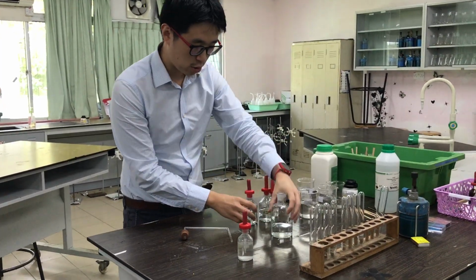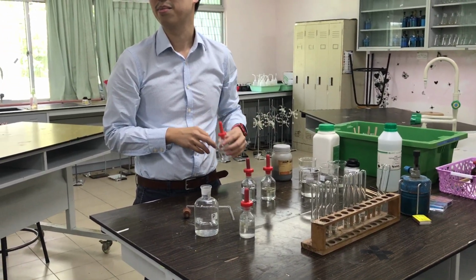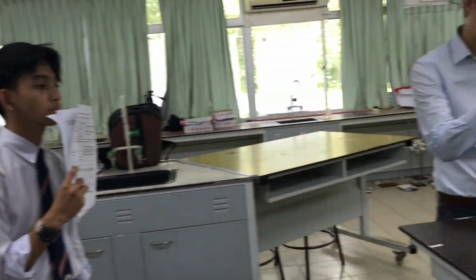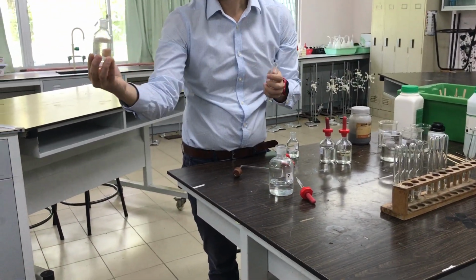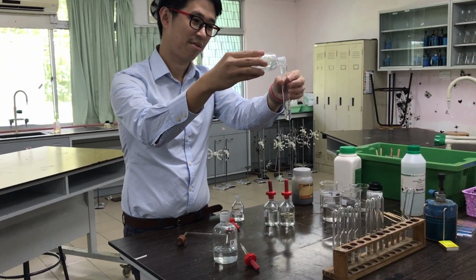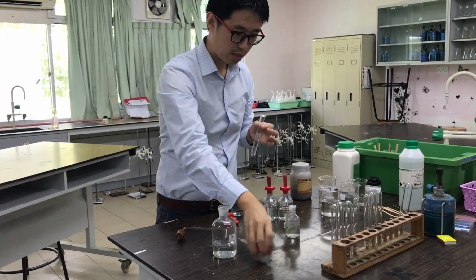Now, I am going to choose one acid. What acid do you want to use? Nitric acid. Nitric acid, okay? So, I should have a test tube. Can someone help me? This is lime water, yeah? It says lime water here. What color is lime water? So lime water is a solution, colorless, okay? Can someone come and hold it for me?